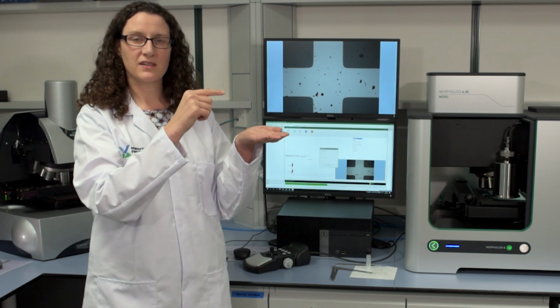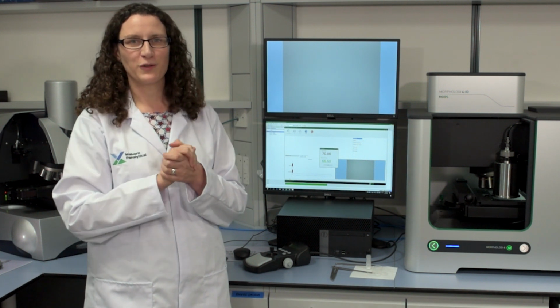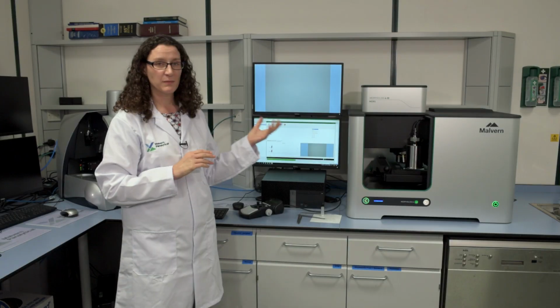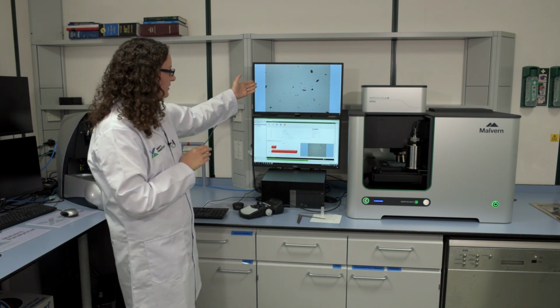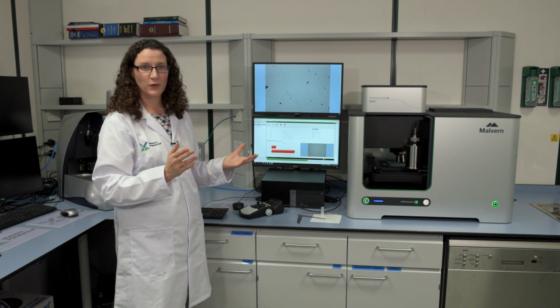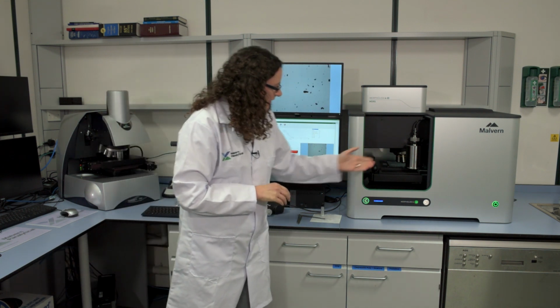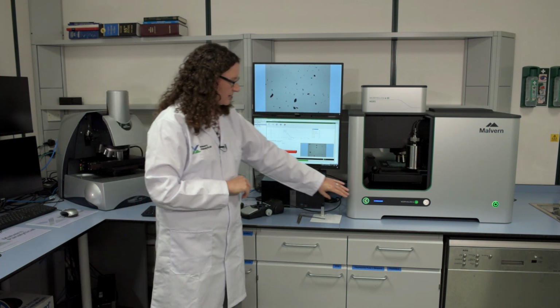That means you have a consistent focus and your sample will always stay at the same focus. And as long as you set your focus correctly, then you'll have a consistent measurement. For this measurement, I also set the focus previously as a position relative to the plate, so it will always be in focus. And you can see here my well-dispersed sample being scanned in focus, even though you haven't seen me touch anything else. So the system is scanning the sample of a small scan area, and we can see the results being displayed in real time.